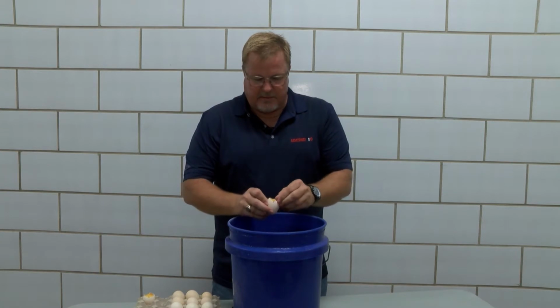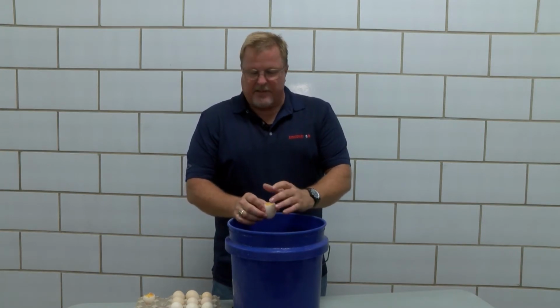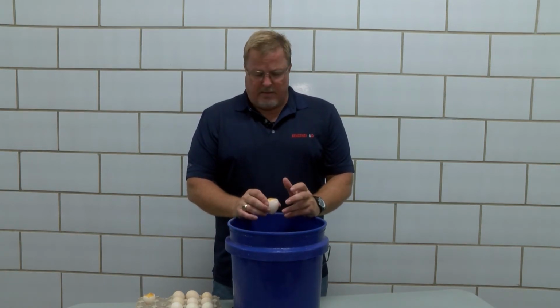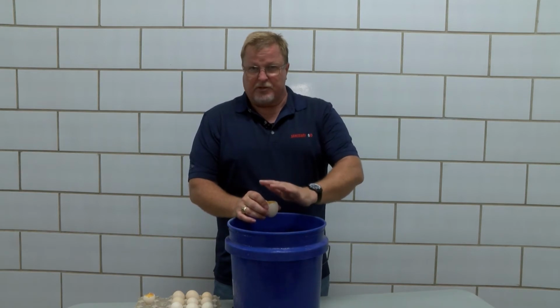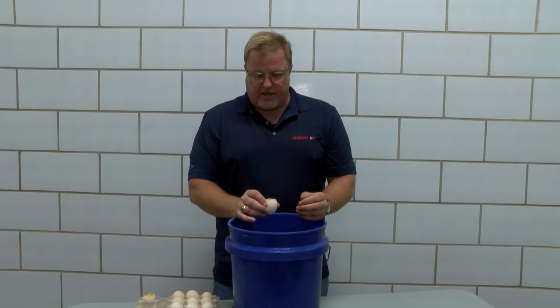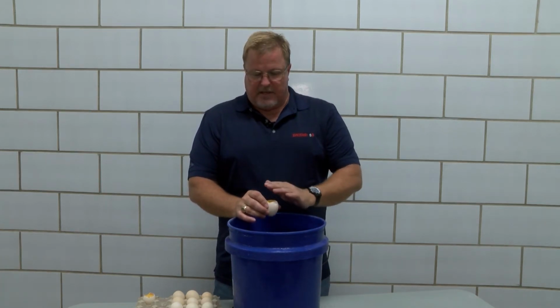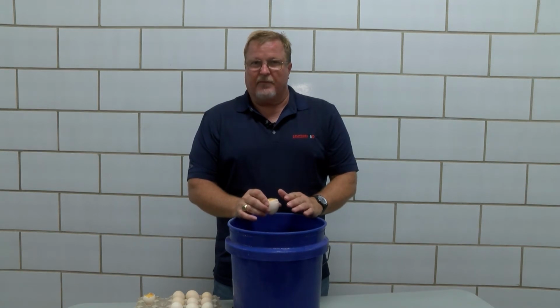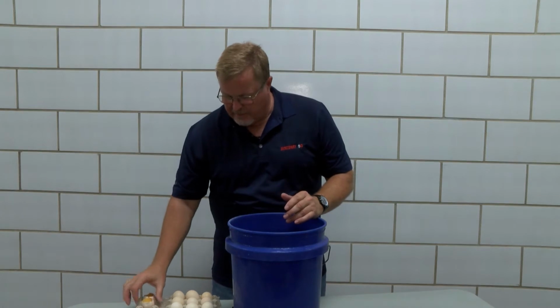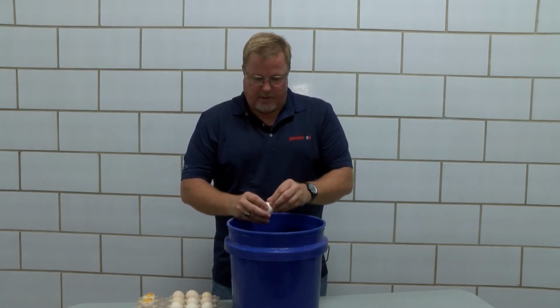Again, so this is another infertile egg. Often at this point in time, we see the yolk has maintained the same color, same structure. The membrane, we're breaking at the air cell end. The membrane is clear like it would be on a fresh egg. Often we'll see on eggs that have embryo development, the membrane starts to turn opaque and white to various degrees. So this looks like that is an infertile egg. The yolk looks normal, everything looks normal.